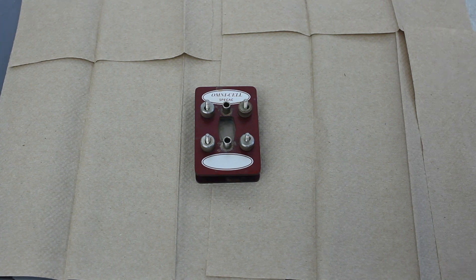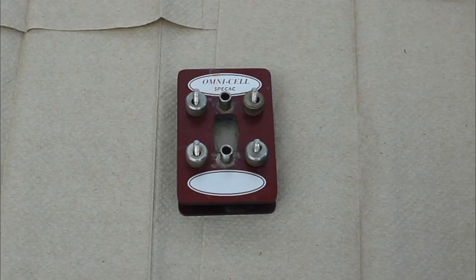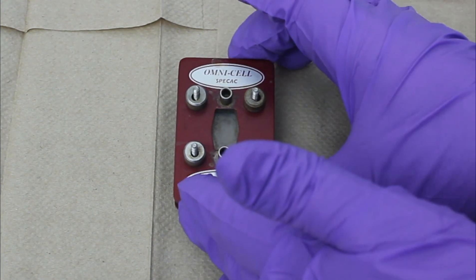The problem with collecting data on air-sensitive compounds is you get lots of decomposition. I work with iron, manganese, other transition metals that when they decompose leave lots of residue.